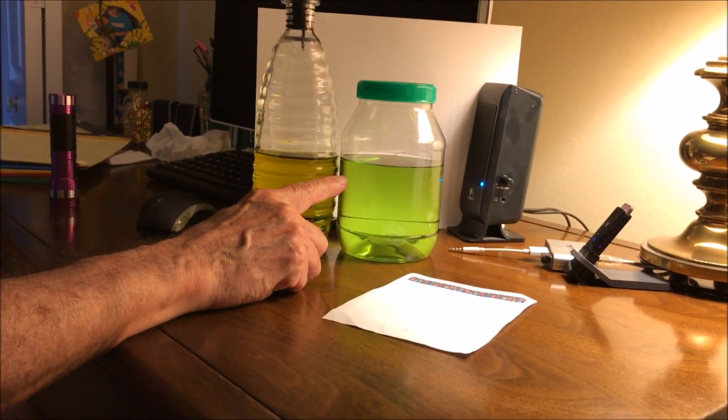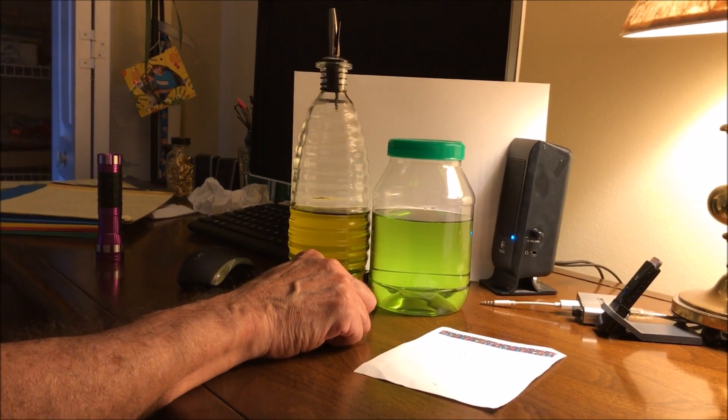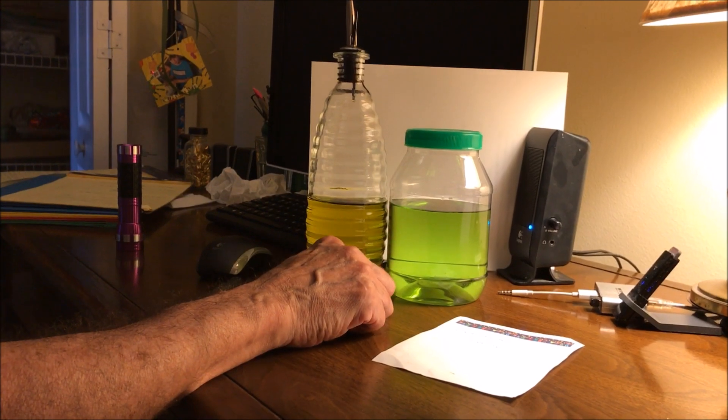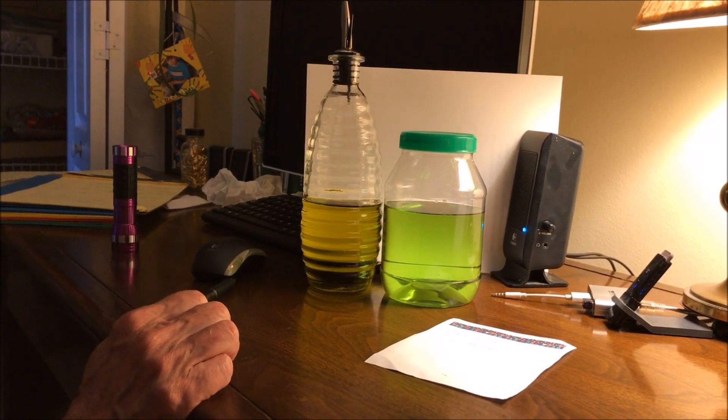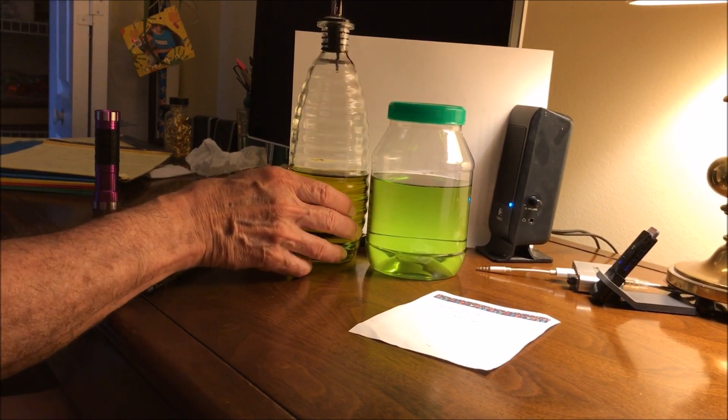We filtered the pothos leaf out and we have the beautiful pea green color of the chlorophyll. And here we have olive oil, which also has a similar color.